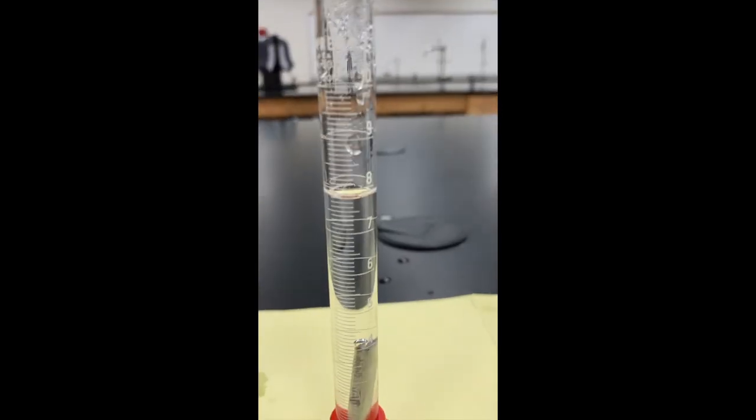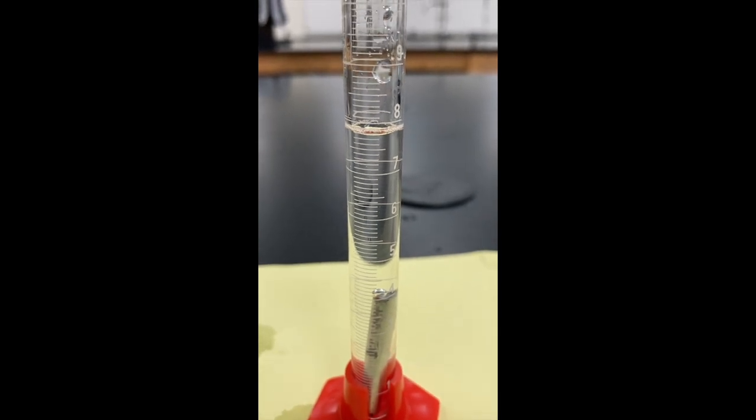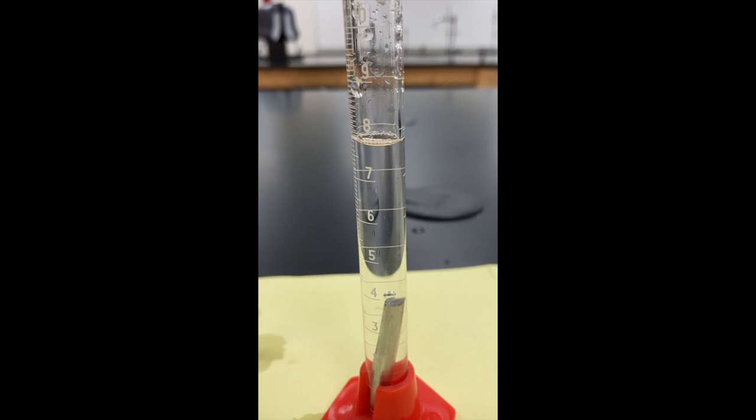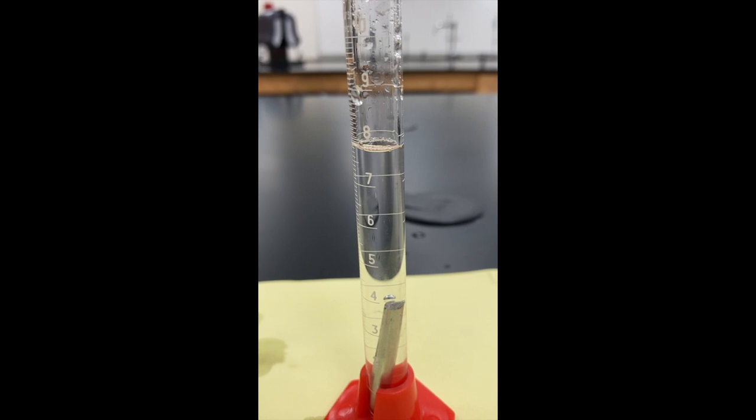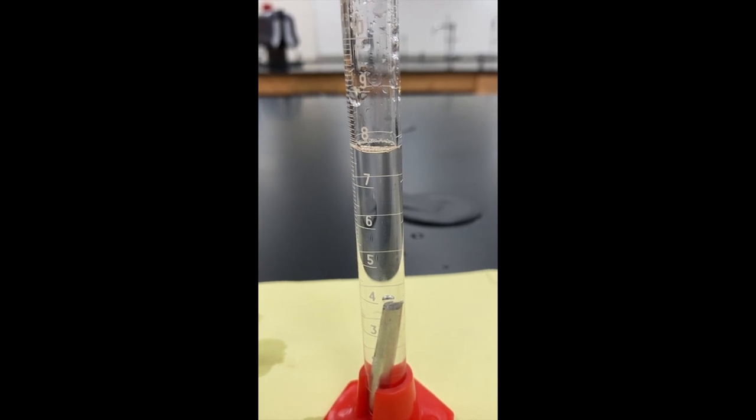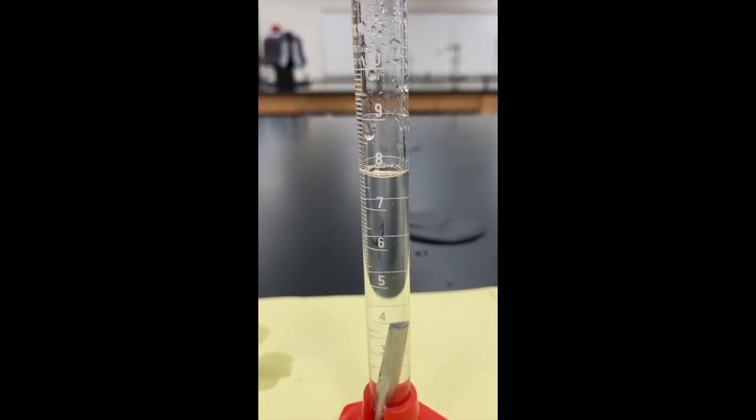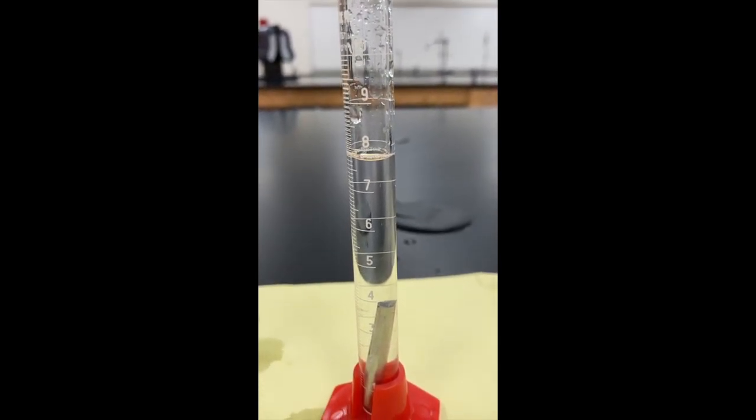Take a look at that. What's on top of the metal right there? How did it get there, and what effect do you think that has on your data? If I shake it, it goes away. Do you think that our data got better or worse?